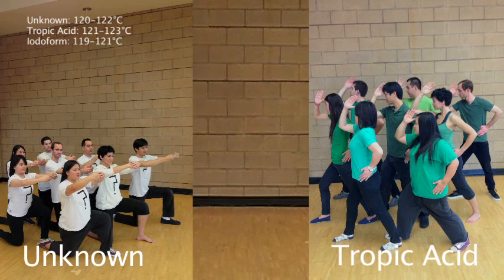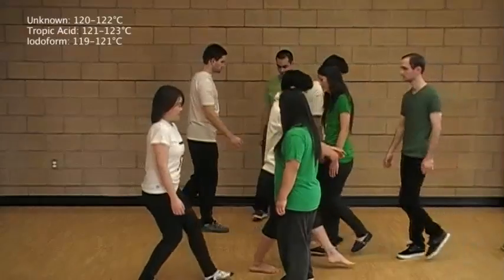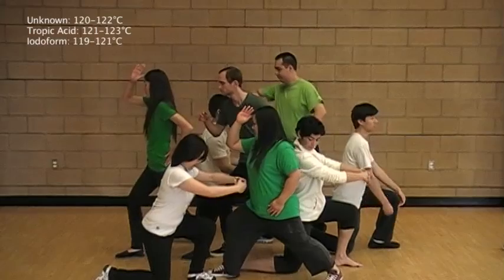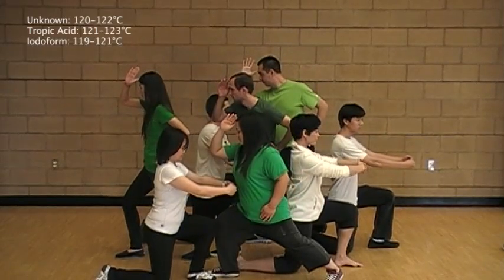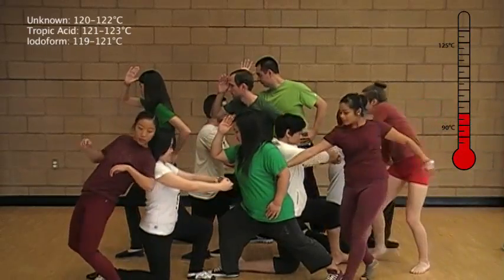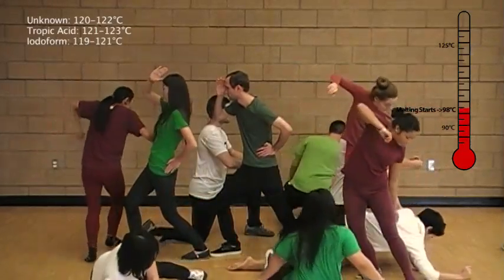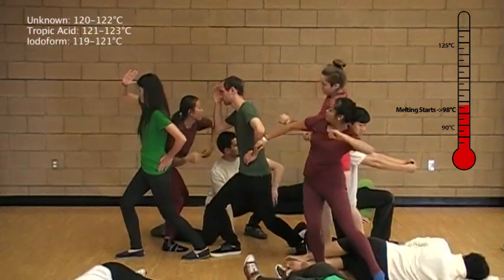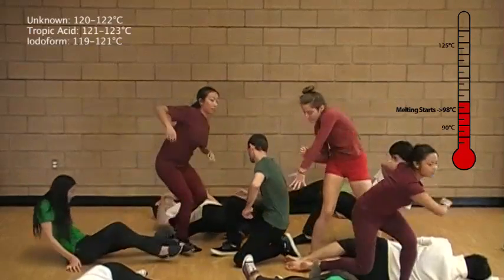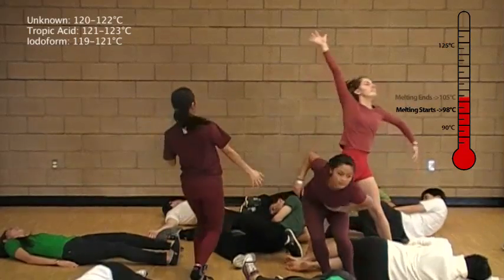Let's take a look at the melting at a molecular level to figure out why. Even though both the unknown and tropic acid have the same melting point, the mixed melting point tells us that they are not the same compound. When the two compounds are mixed, the molecules have a hard time stacking together. Just like earlier, you can imagine the tropic acid acting as an impurity to the unknown compound, lowering the melting temperature and broadening the melting point.